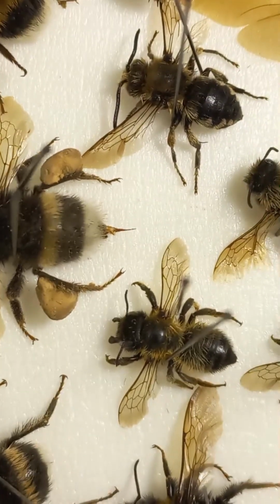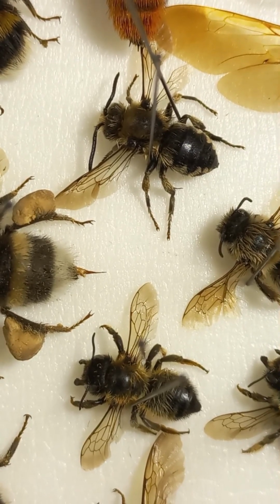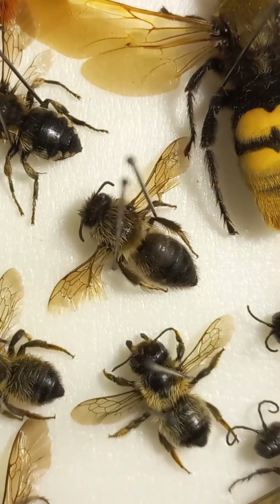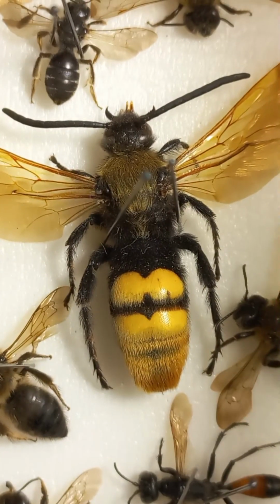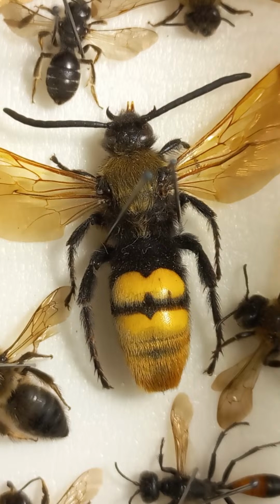These are solitary bees. One is Anthidium on the upper side, and one is, I guess, Megachile on the downside. One is Andrena on the upper side and Megachile on the downside. Here you can see the male of a solitary wasp called Megascolia, family Scoliidae, which is parasitic on rhinoceros beetle larvae, Oryctes nasicornis.